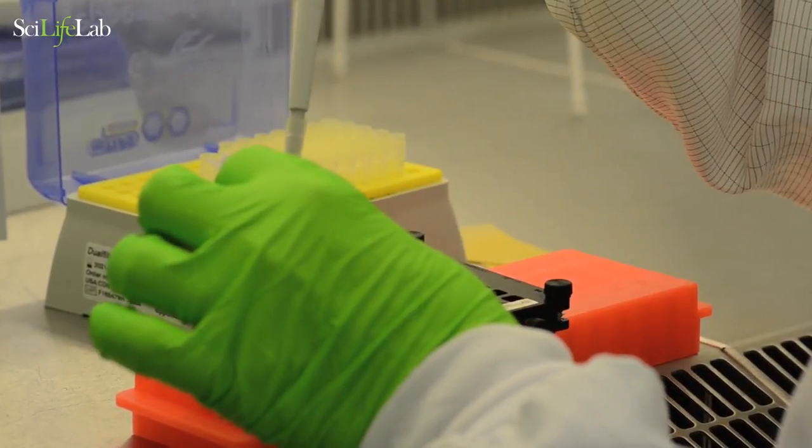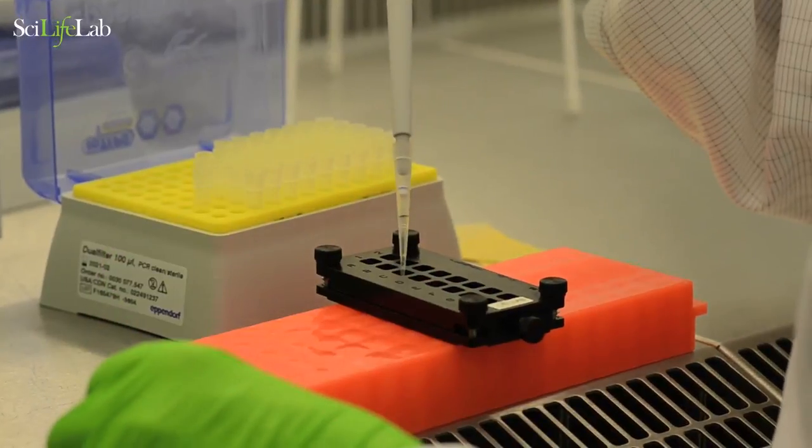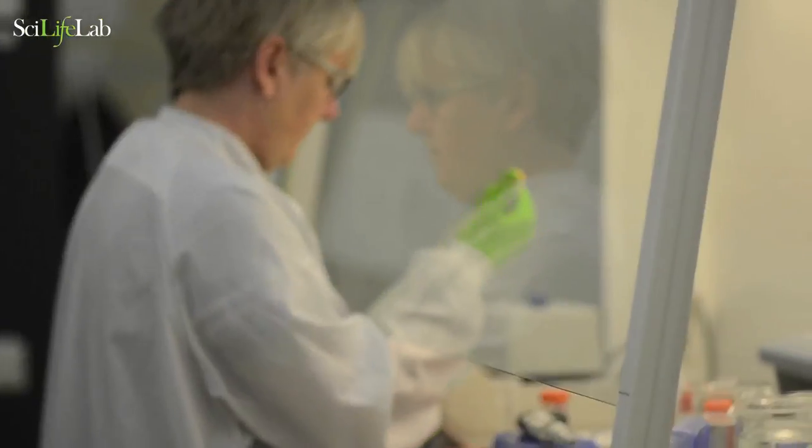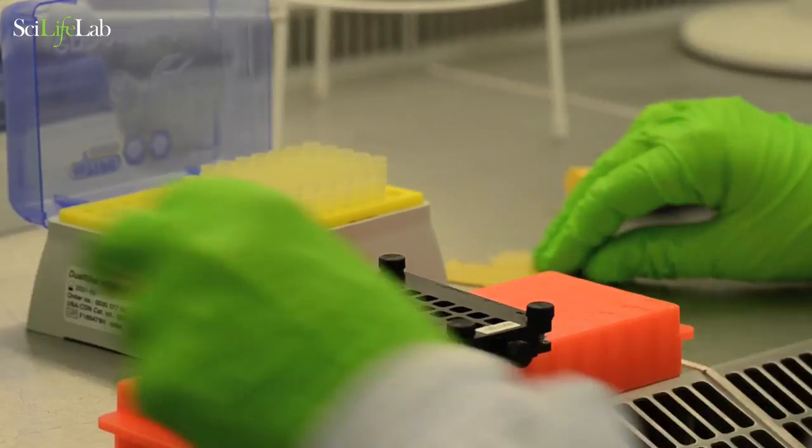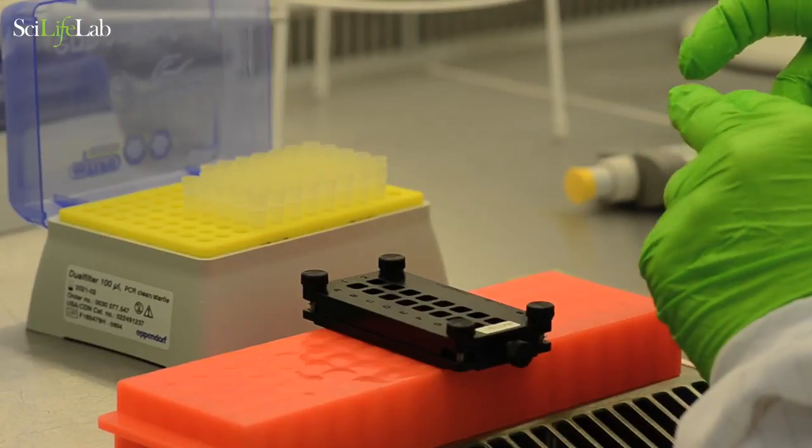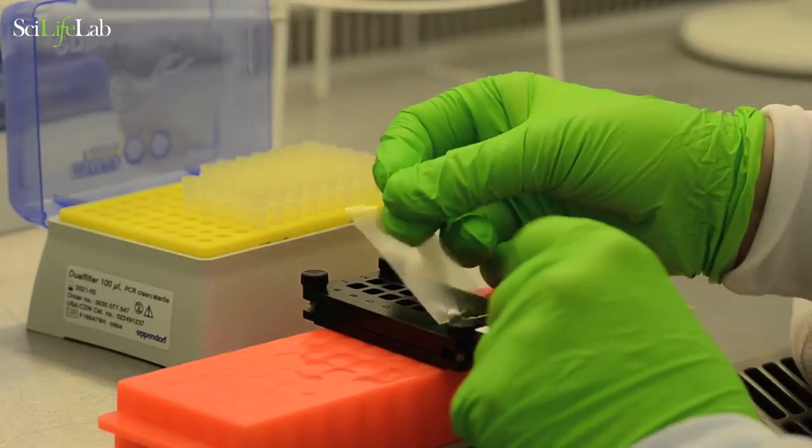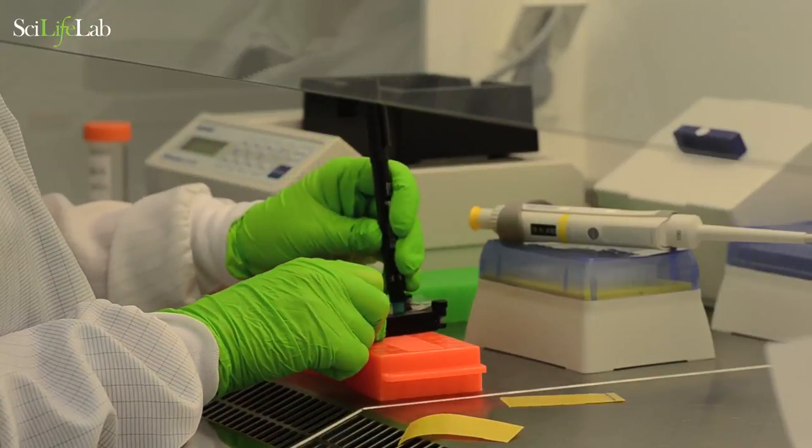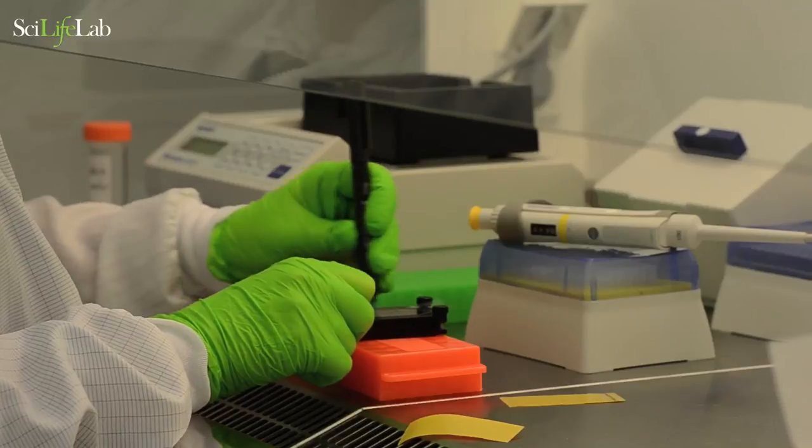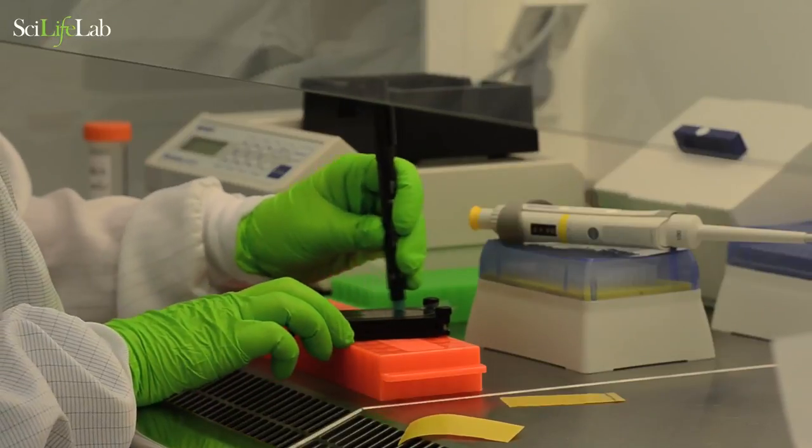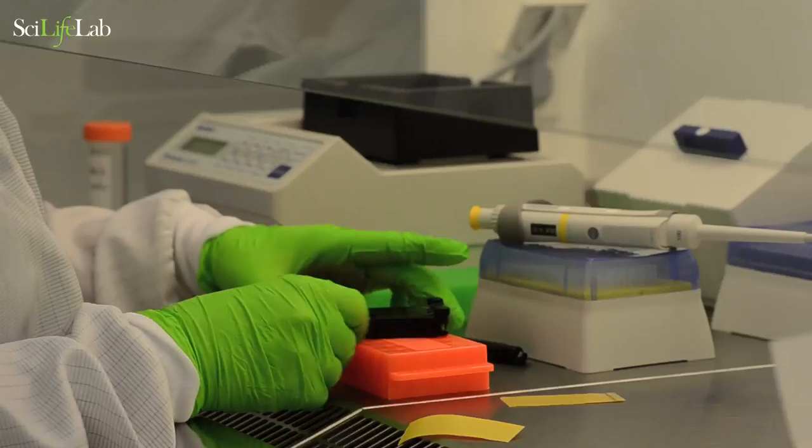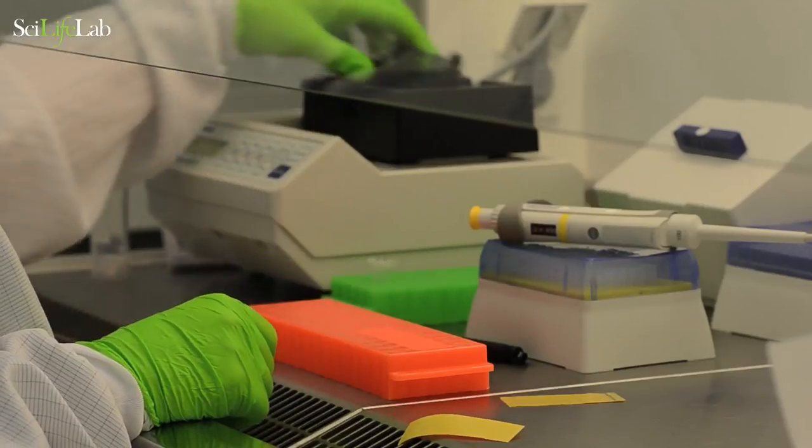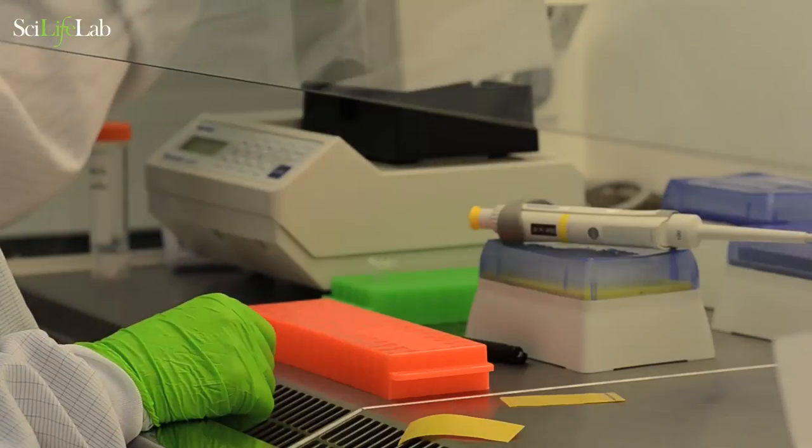Add a pre-warmed collagenase mix. Seal the cassette and check that the tissue is completely covered. Incubate at 37 degrees for 20 minutes.